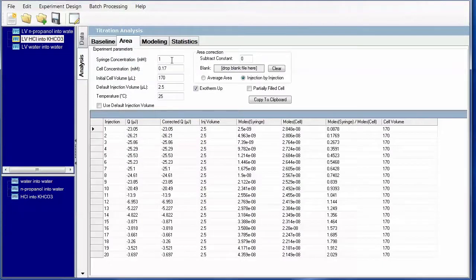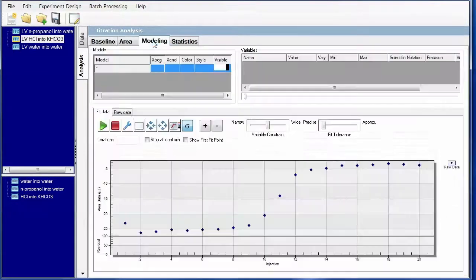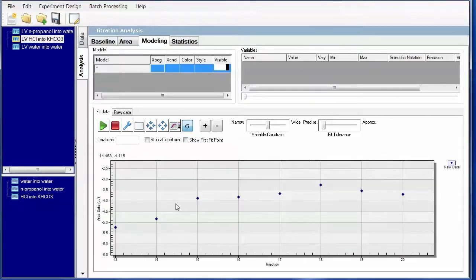Area tab. This is where concentrations as well as cell volumes are important. Next, go into modeling. So first thing, we mask that first data point. So first I want to do is zoom in on this area. These last few data points of this heat right here are the heat of dilution. And we're coming in around the same place where we did with the water, around -3, -4.